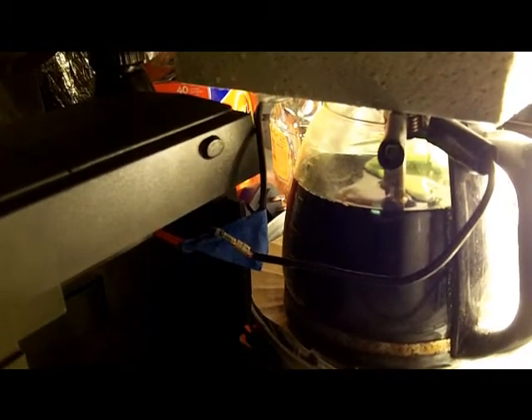With this side I'm hoping to capture the darkness of the solution all the way from the other side. You can see some light bouncing off the bottom, but the solution itself doesn't really even transmit much light all the way through across the coffee pot.